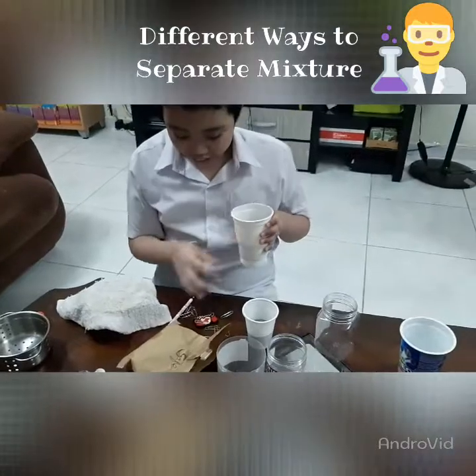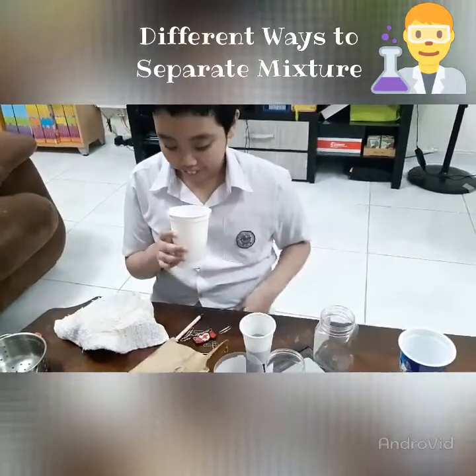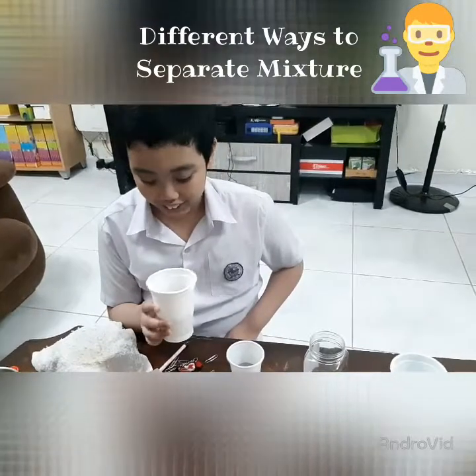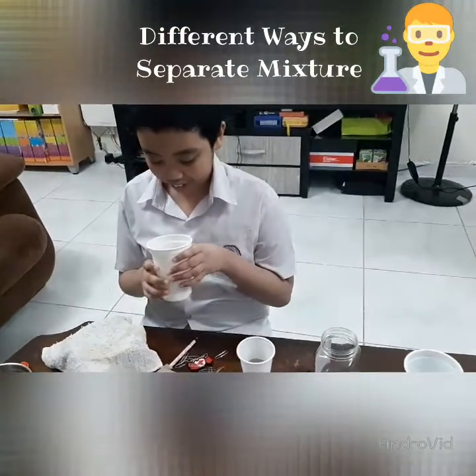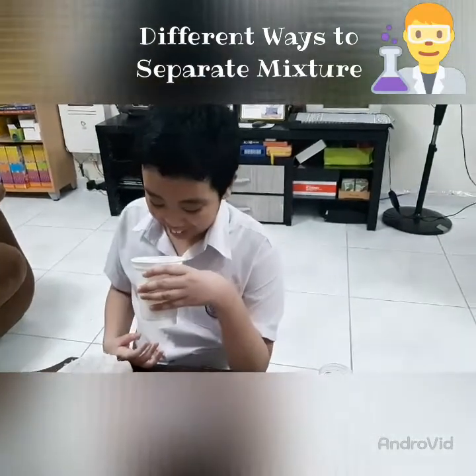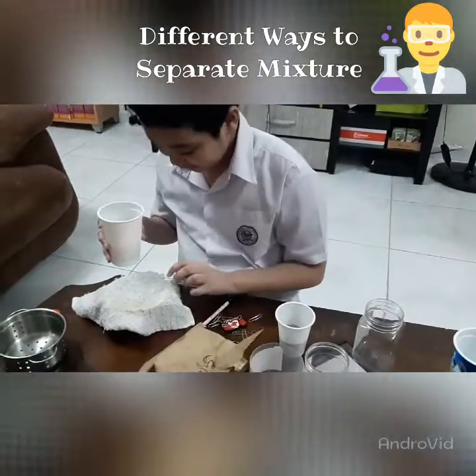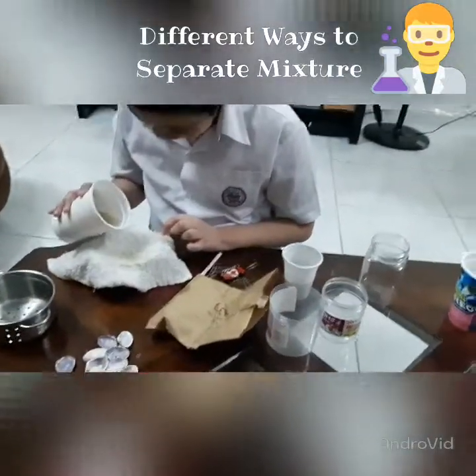I'm pretty sure this is a suspension, so the most efficient way I'd try to separate this is by either waiting for the sand to sink down, or sedimentate, or you can use filtration like this. Let me try filtering it with this.